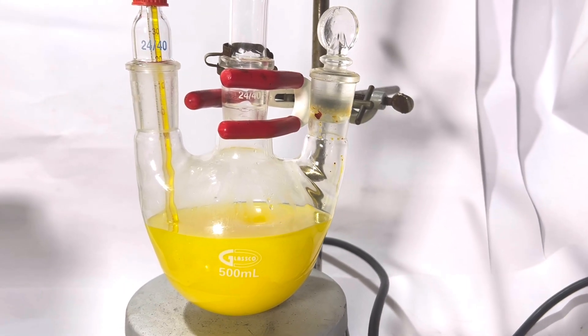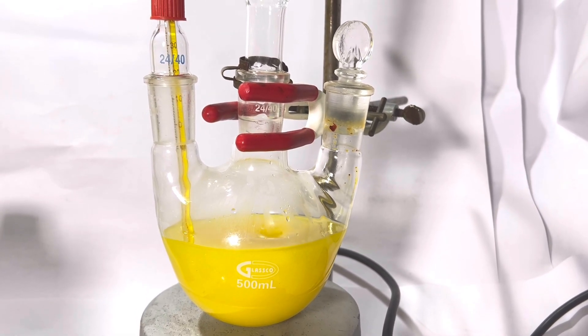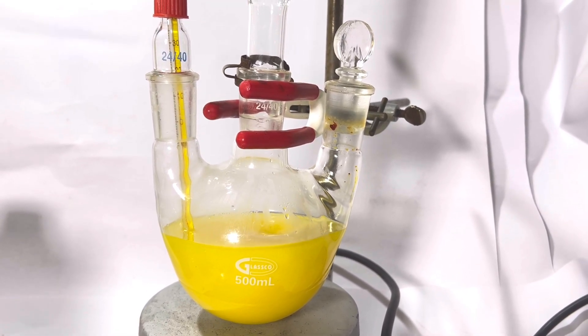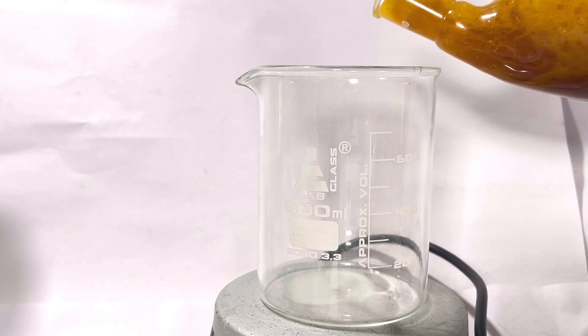You can see when the time passes by, the color of the solution slowly darkens and a deep yellow color results. After 4 hours, you'll notice that there is not much change of color in the solution.